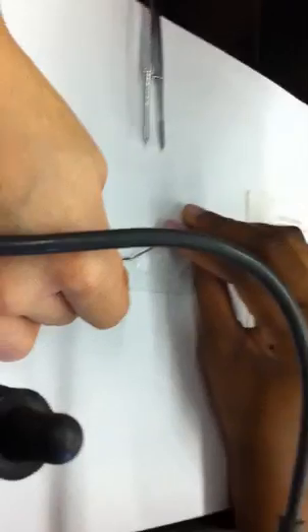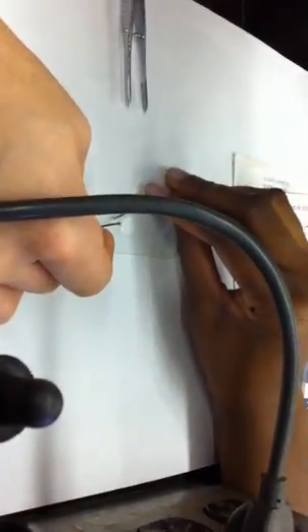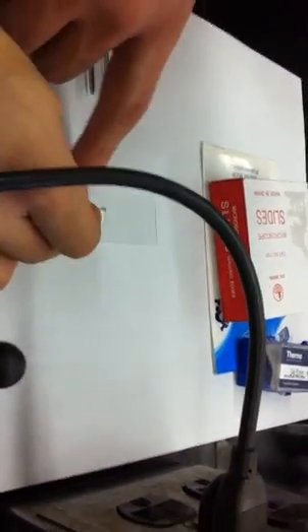Open out. Just trying to squish it out. You'll see... Squish it out. You'll see your... What is it? It's just kind of like messed up. Okay, so at that point you can move it over. You can move that saline solution there.